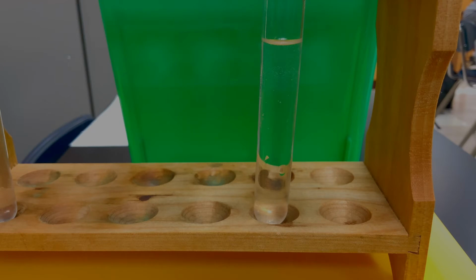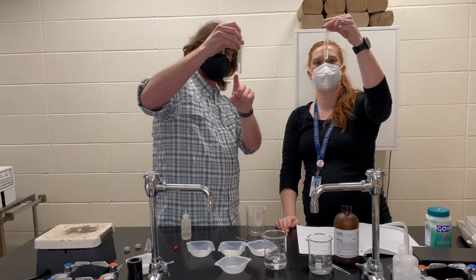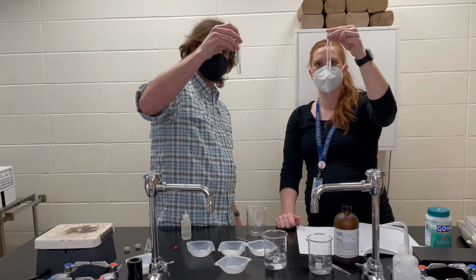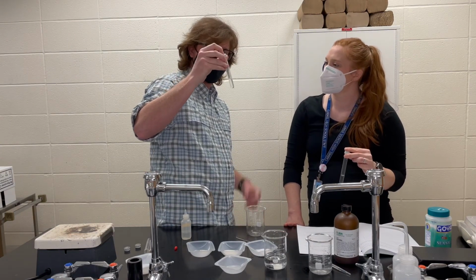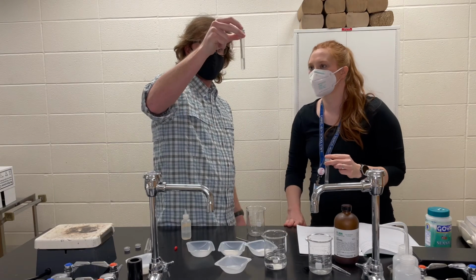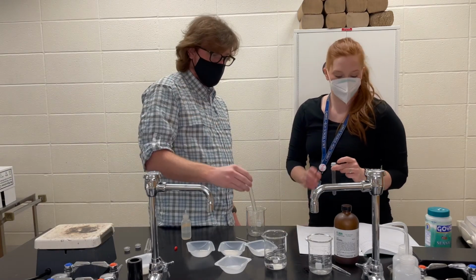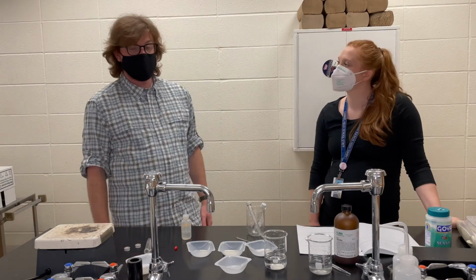And then let's check in on our hexane after I've shaken it up and let it sit. It's still got the same situation going on. We've still got 2 layers in the water and cyclohexane test tube. What do you got going on with your ethanol? I noticed that it bubbled for a second and then it went back to normal. It just looks like one substance throughout. So go ahead and make some observations about those, compare and contrast.